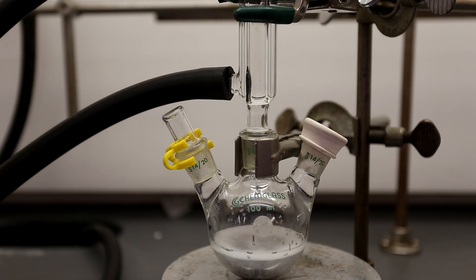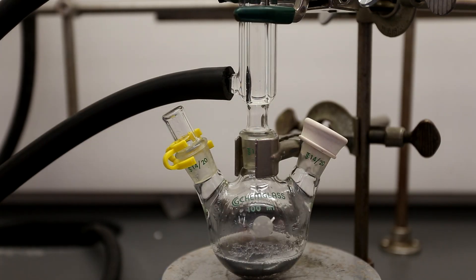If the reaction does not start, adding a couple crystals of iodine almost always gets it to start. You can see here that the solution has turned black and a lot of the ether has been lost, so you're going to need to add more.